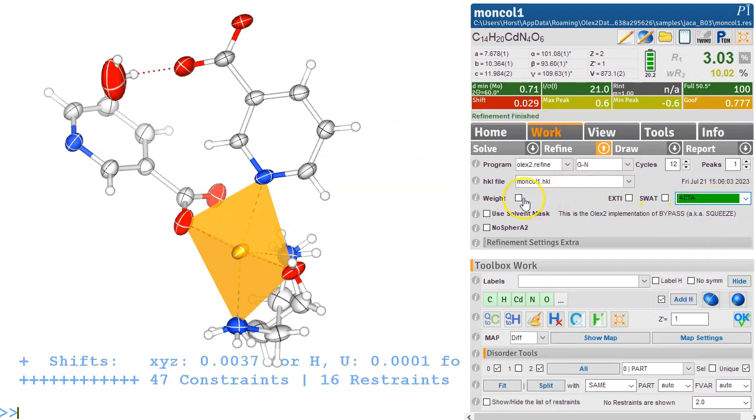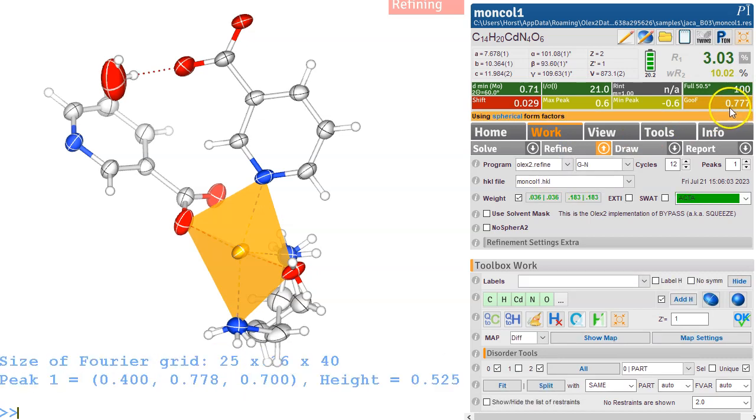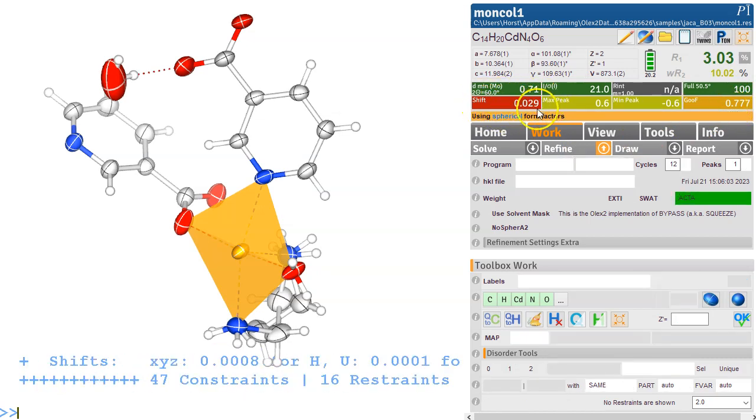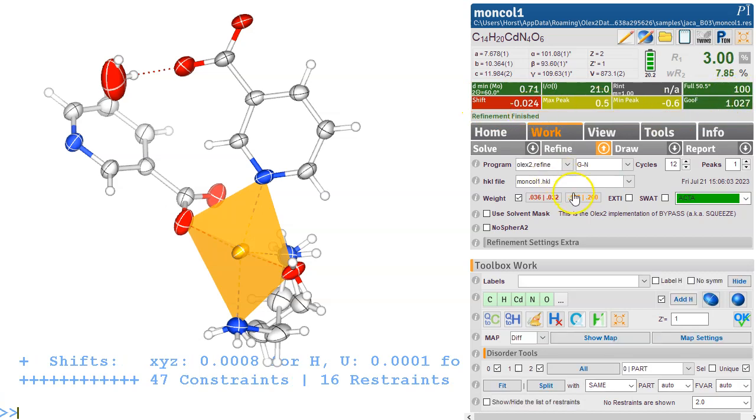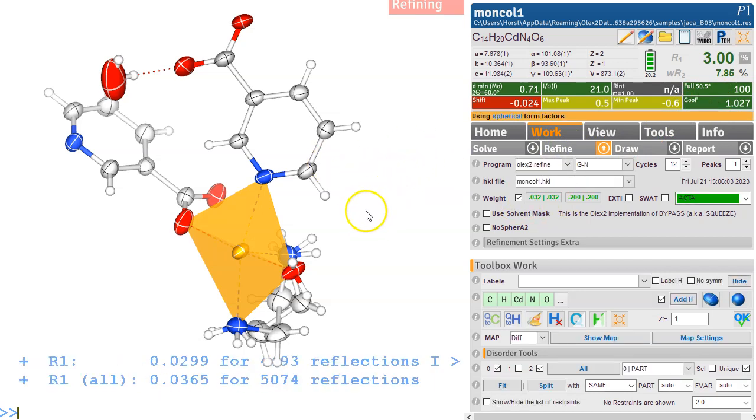We haven't got that. We need to switch the weighting scheme on to make sure that the goodness of fit becomes reasonable, i.e. close to 1. And let's just do this a few times. Hopefully the shift will have settled. The goodness of fit is still good. But the weighting scheme is still showing us a bit of red here.